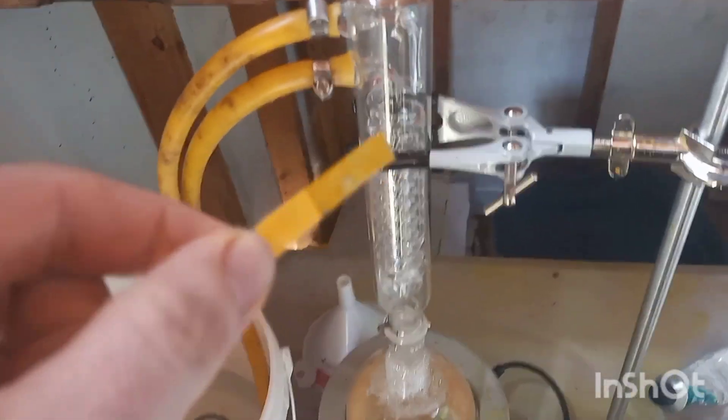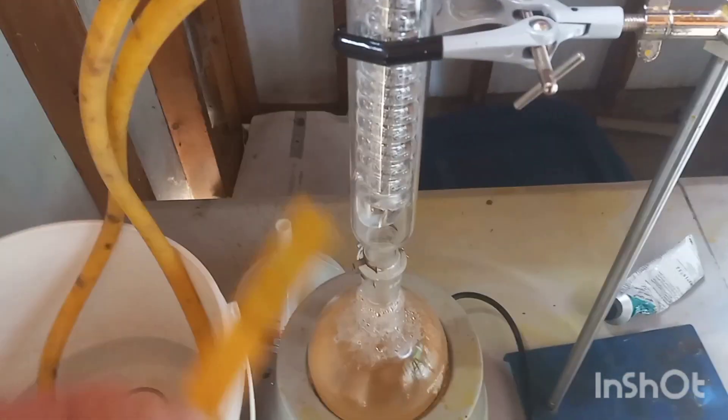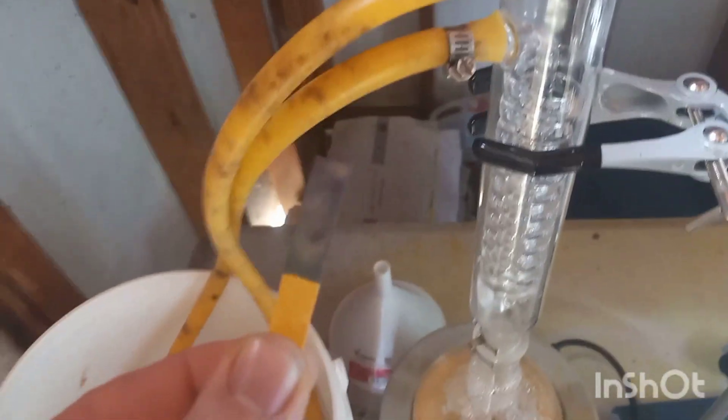These are stereotypical amine tests with the pH paper. 1-butylamine is a strong base, so if we stick this in here and there's any presence... oh yeah, definitely being made.